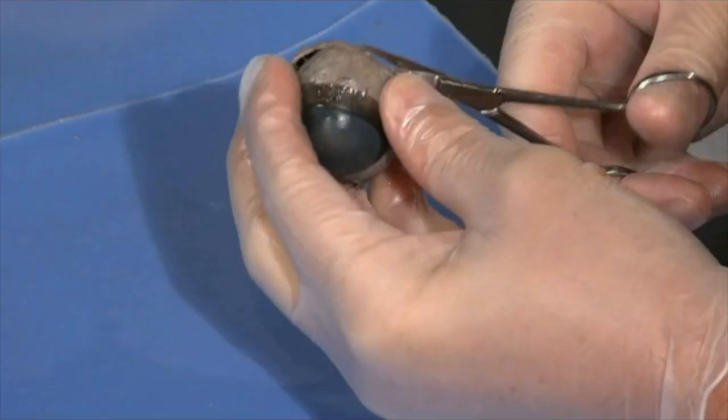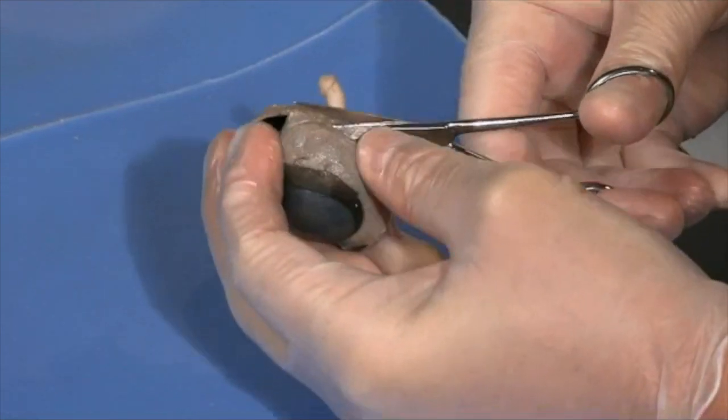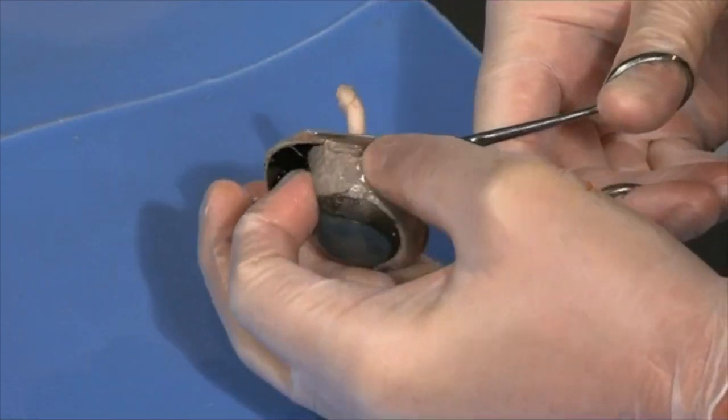You said there's no way of really messing up too much if you're in this section. I don't think so. What happens if you're farther towards the front? Yeah, you kind of want to stay in the middle. There are some structures, the ciliary body and such, that you'd really like to stay away from. So let me make that last cut.